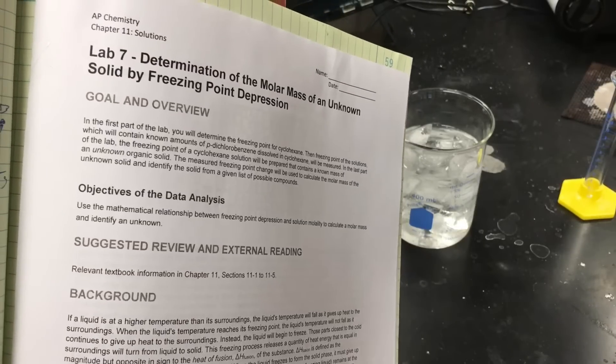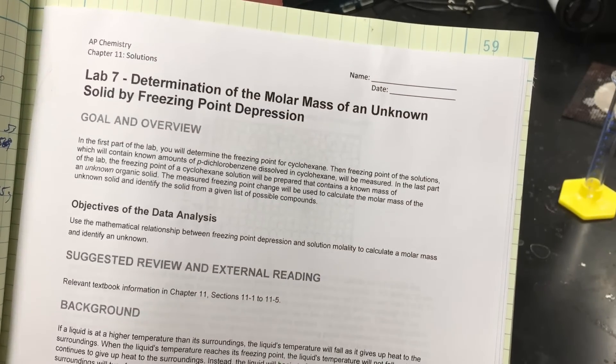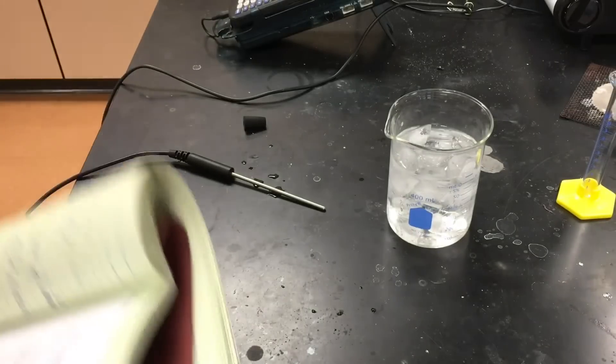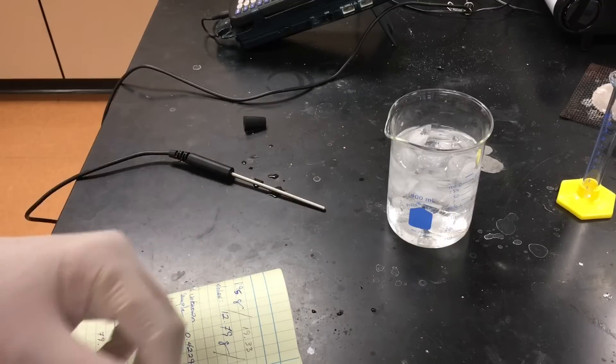Our seventh lab, the determination of molar mass of an unknown using freezing point depression. We have an organic unknown that we have to identify using its molar mass by using a freezing point depression of cyclohexane.